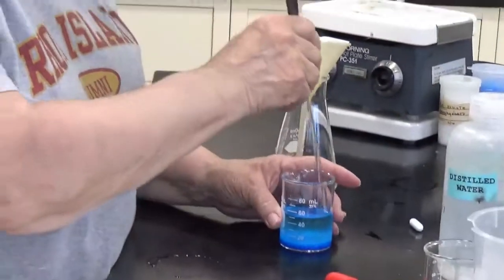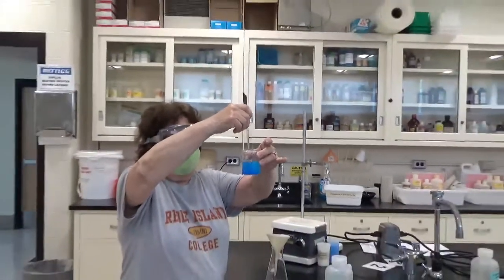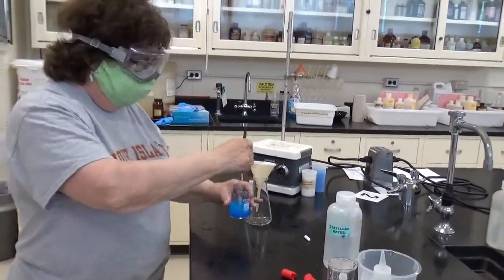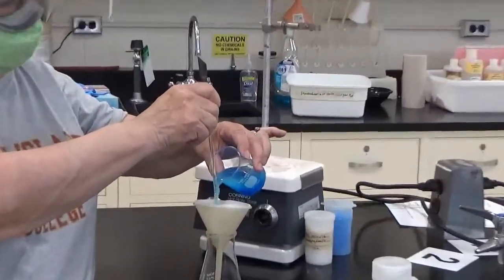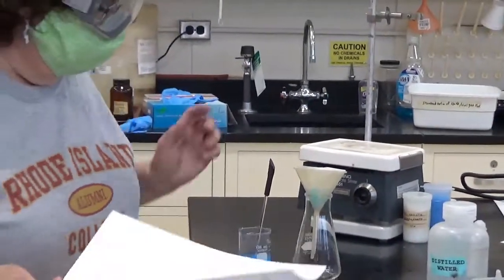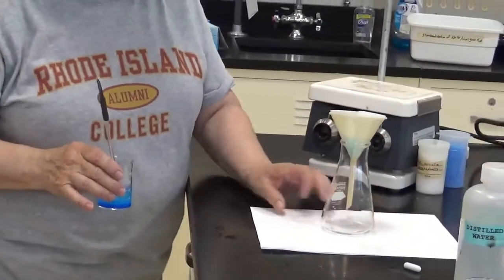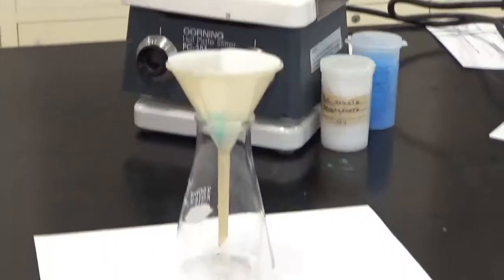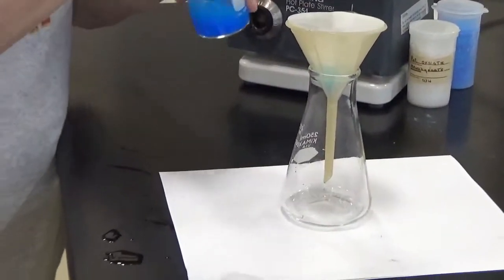And what I'm going to do is I am going to mix my product constantly. Because if I don't, I'm just going to get liquid at the top. I want to mix this and I want to filter it using the spout. I don't want to stick this into the filter paper because it'll break. And I'm going to put some white paper under here so you can see what's happening. You can see how nice and clear that is. I put the blue solution in the top and I'm getting a liquid that's clear coming out the bottom.